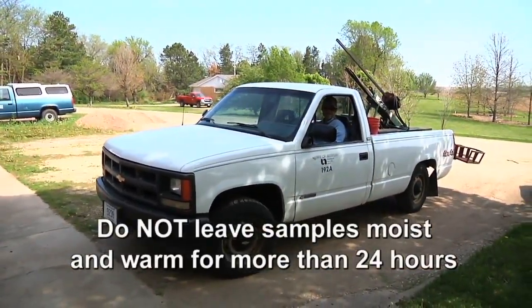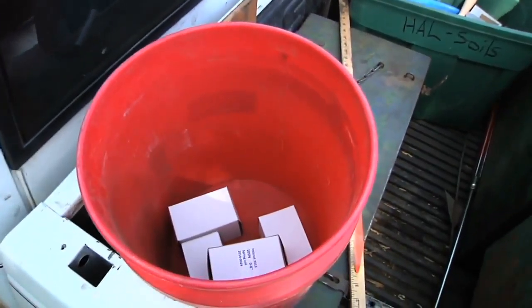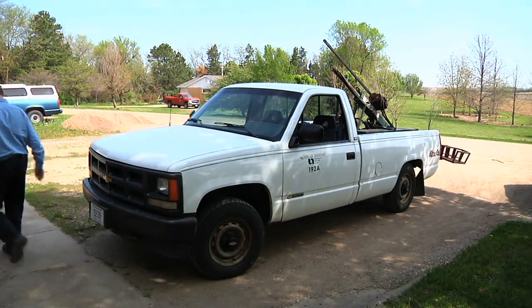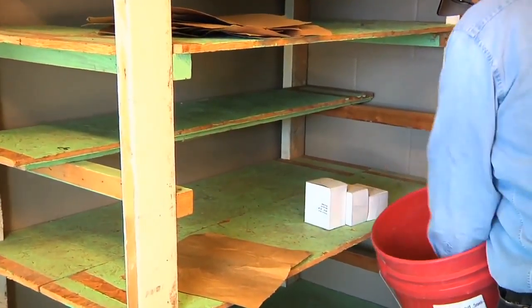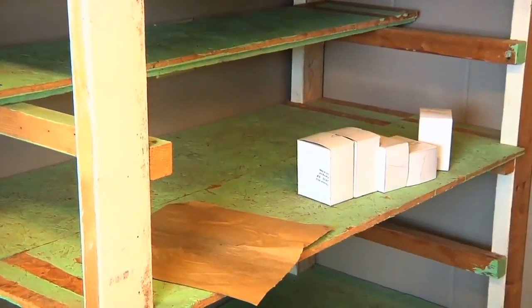Do not leave samples moist and warm for more than 24 hours after collection. If moist soil samples are stored for extended periods of time, additional mineralization from soil organic matter can occur, and this will increase soil nitrate concentrations and also change our recommendation. Some other nutrients may be affected as well.